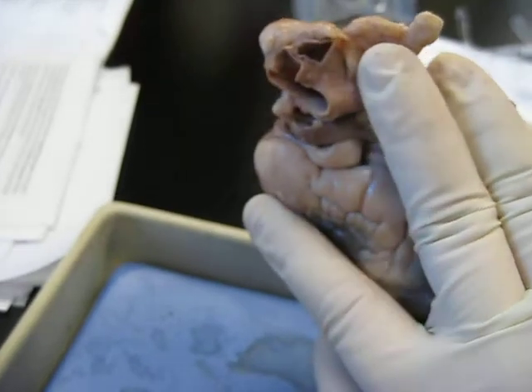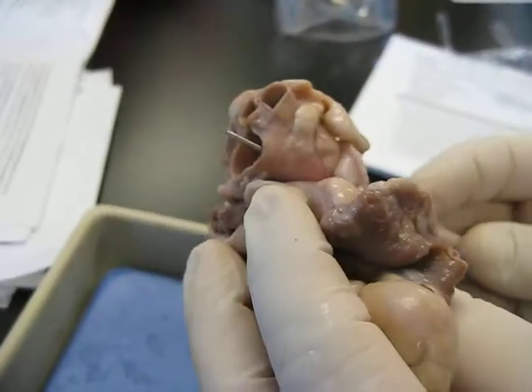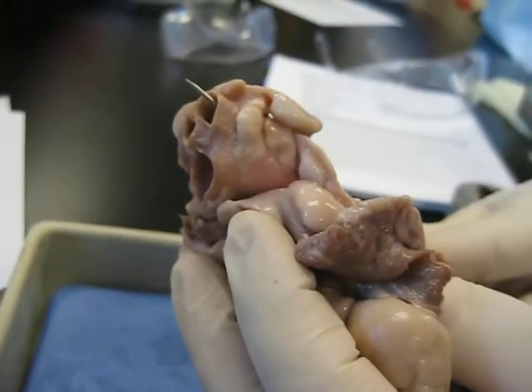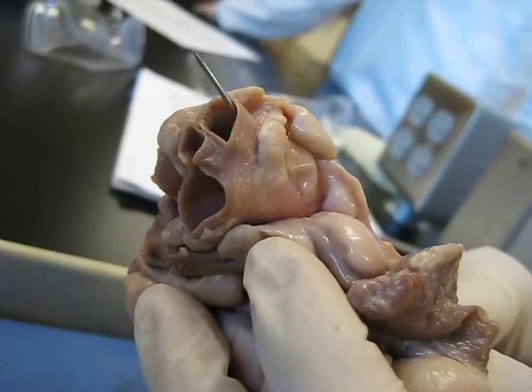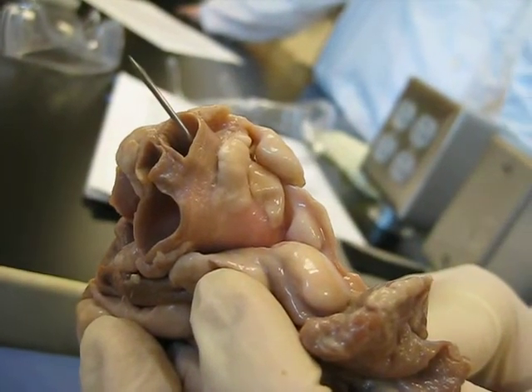Now, what's this first thing? Oh, I thought that was the vessel. It's not. This is. Here we go. If this is a pointed one, here's the aorta going into the aortic arch, but do you see this first branch coming off? It could be the brachiocephalic. Do we need to know that one? Yes. A brachiocephalic trunk.